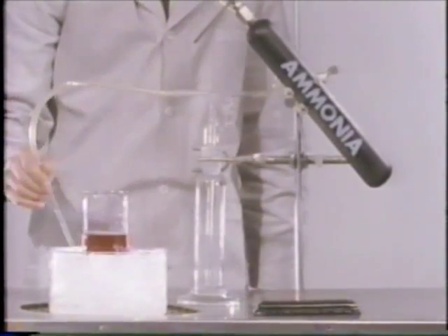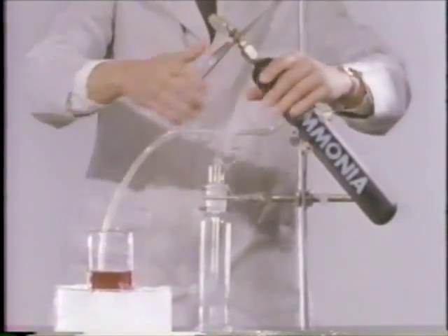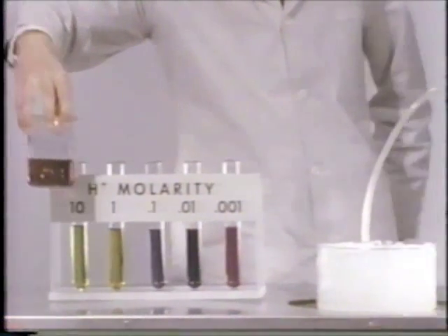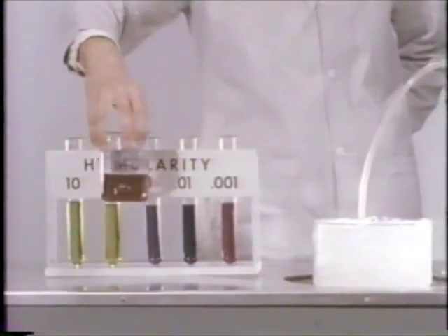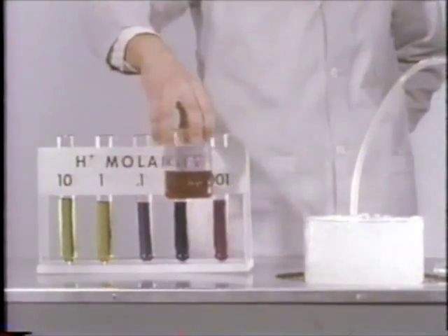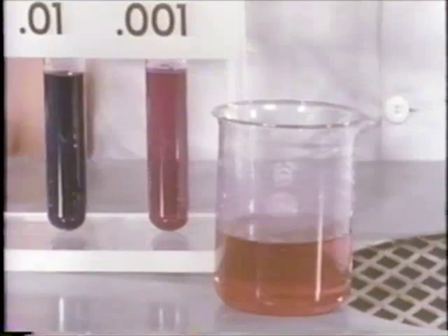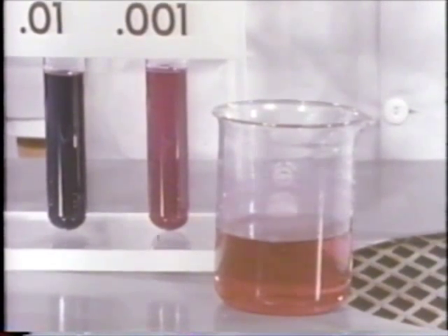Let's compare our product with the known indicator colors. We see that the final solution, ammonium nitrate, has a hydrogen ion concentration of one one-thousandth molar or less. Few loosely held protons are present. The acidity is low.